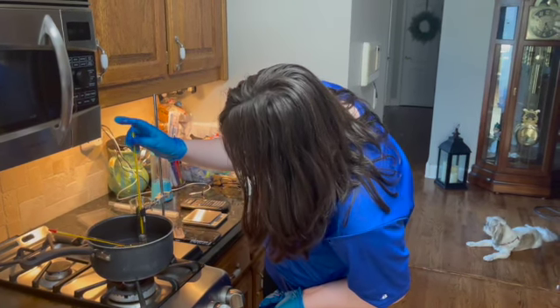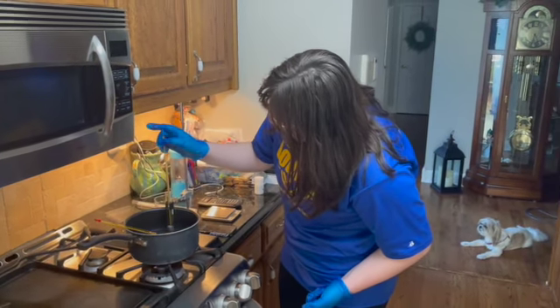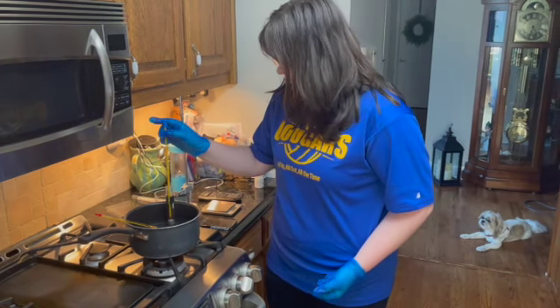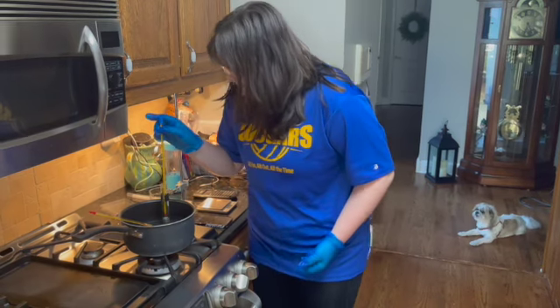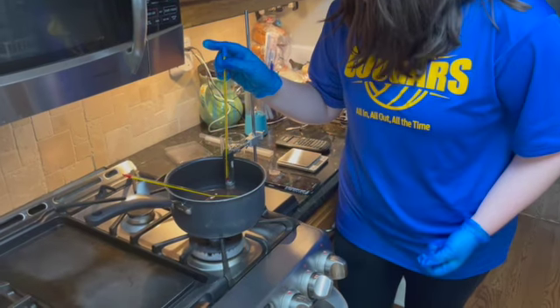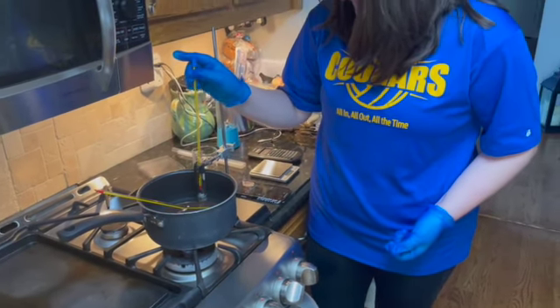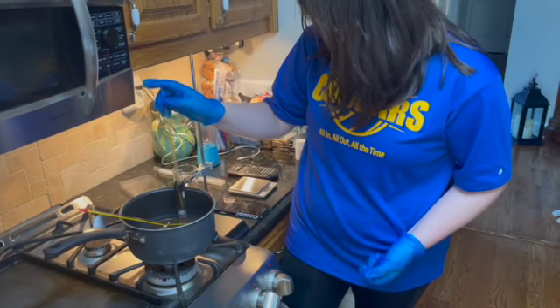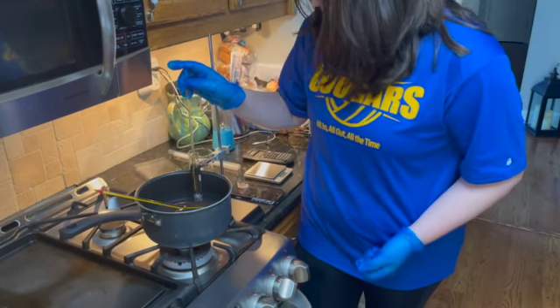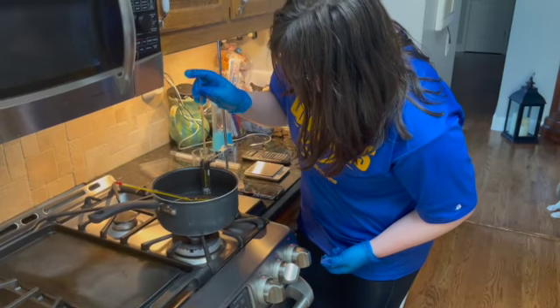Okay. So now that we're up to the first minute, it has raised the temperature of the paradichlorobenzene to now 35 degrees Celsius, and I can see that it is starting to melt. So this is working. Let me just keep looking at it, make sure that it's still working and all that's underneath, and it seems so.